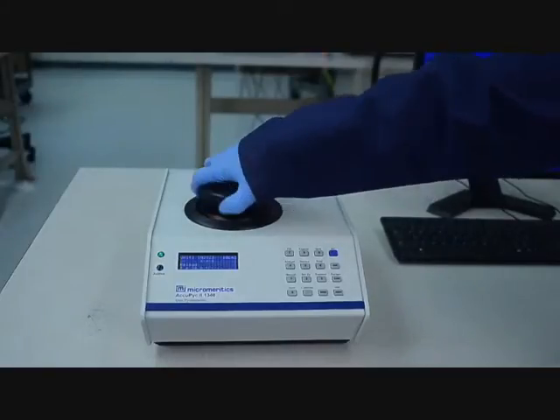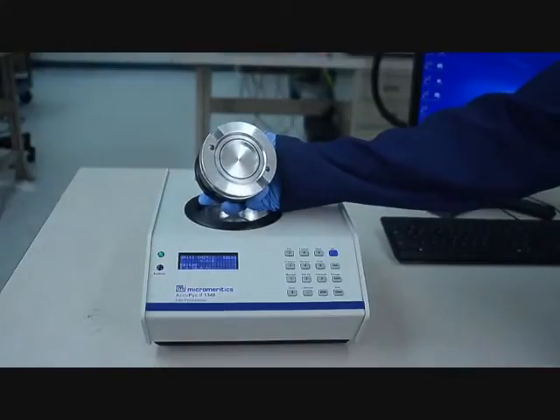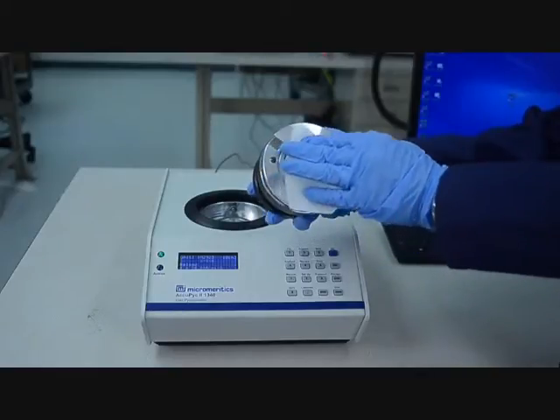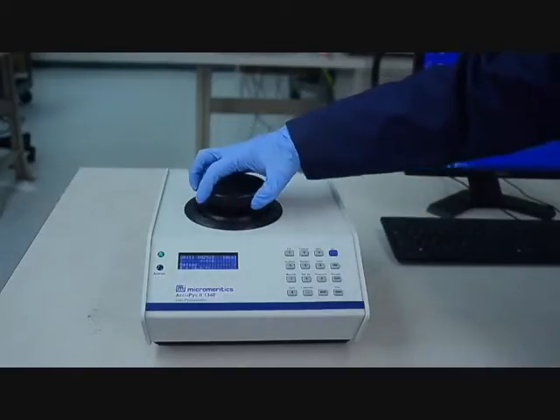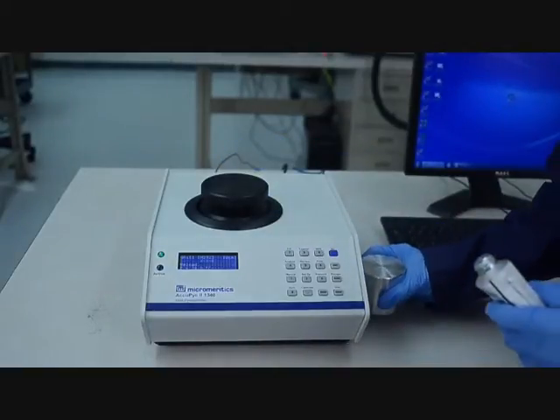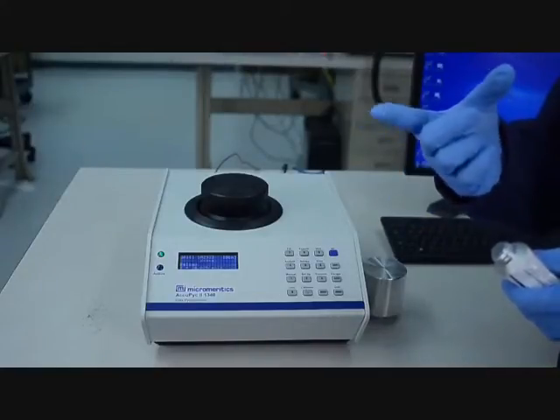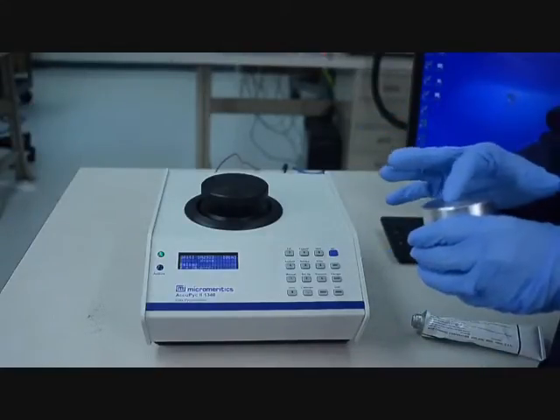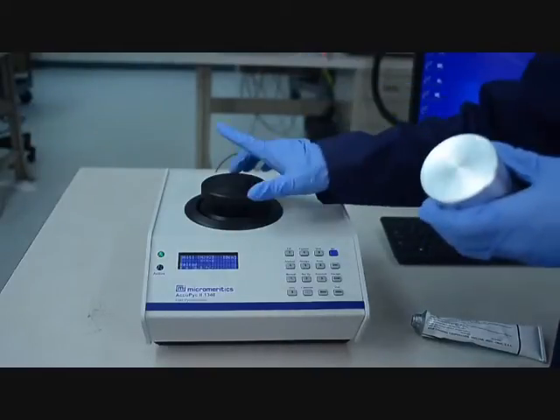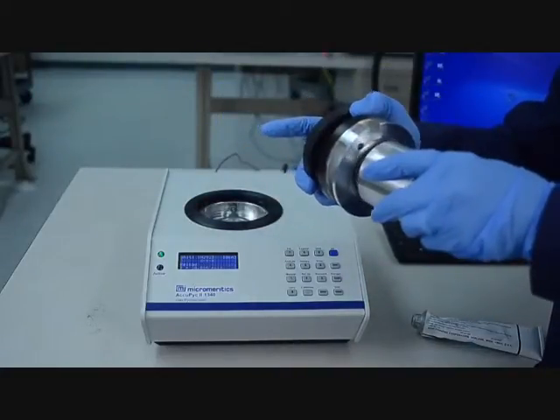The same force is applied between the cap and chamber with every analysis, virtually eliminating any alteration to the sample measurement. You can see here an O-ring on the underside of the sample cap. It needs to be kept clean to function properly. Clean with a laboratory wipe. Place a thin coat of grease on the greasing disc using a latex glove. Do not use your fingers to apply grease to the O-ring. Too much grease on the O-ring will change the volume.